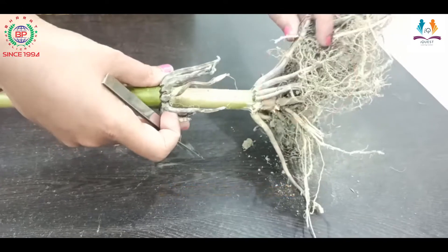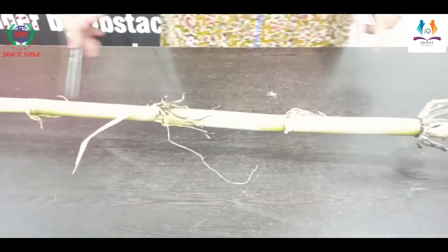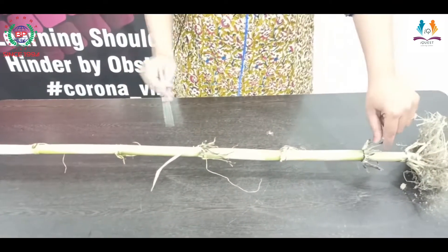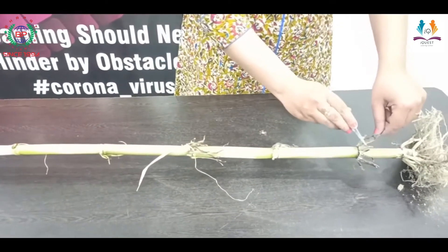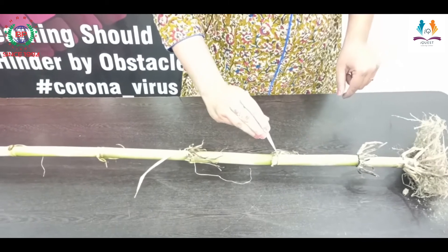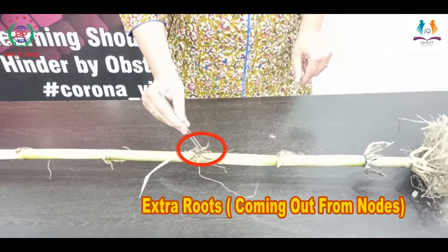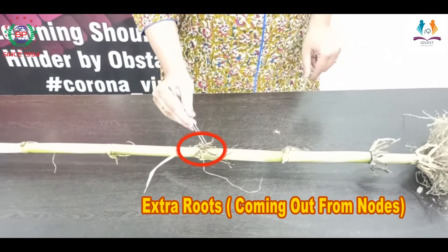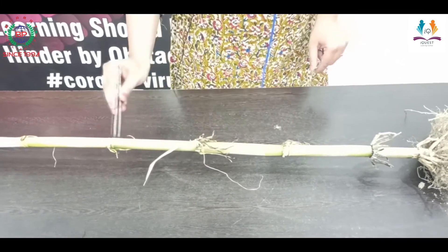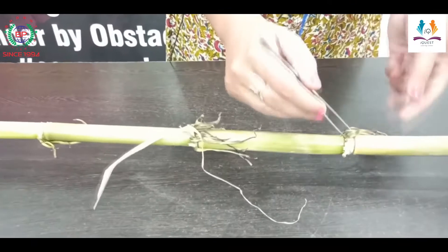You can also see these extra roots which arise from the node of the stem. As we discussed with the tulsi plant, these points are the nodes.